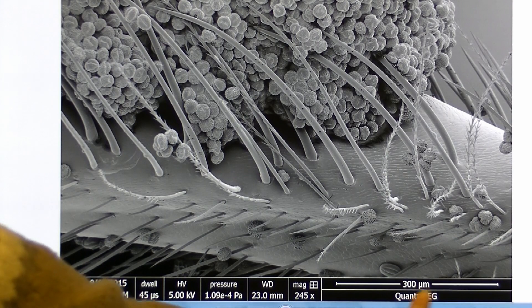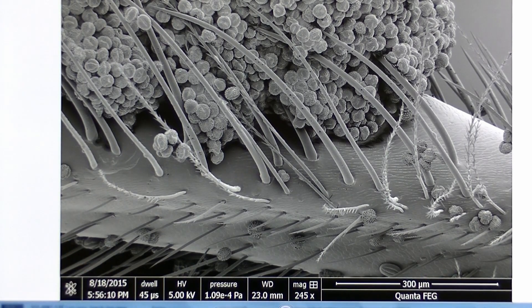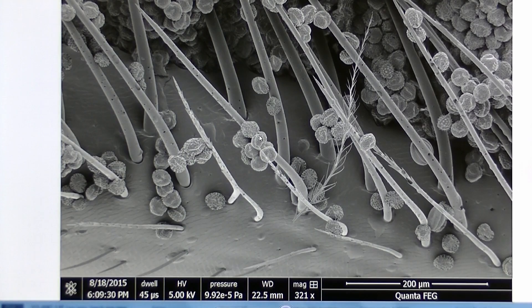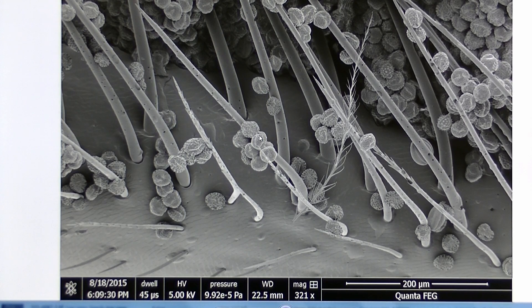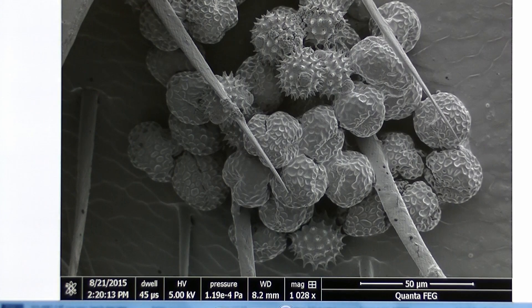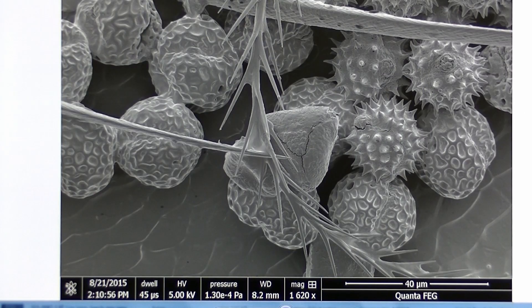The scale bar here shows us the size. The surface detail of the pollen grains allows us to tell what species the pollen has come from.